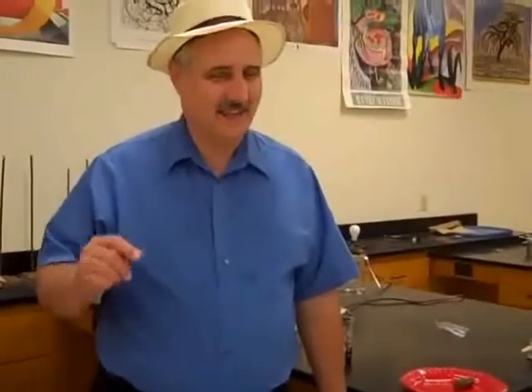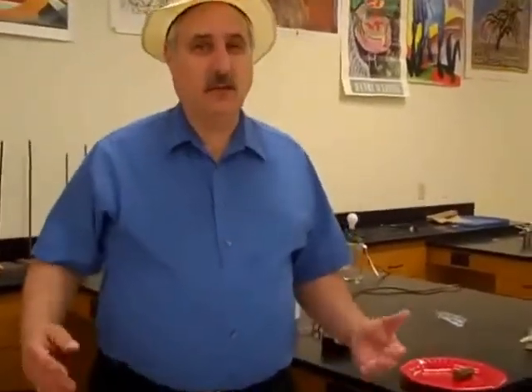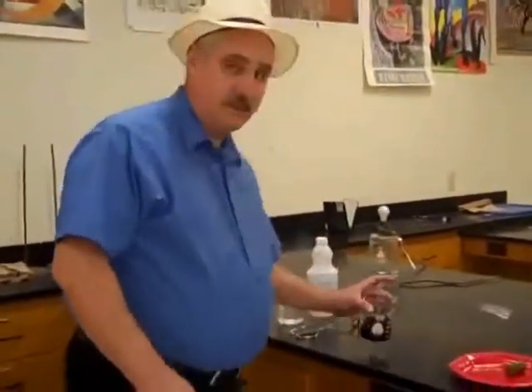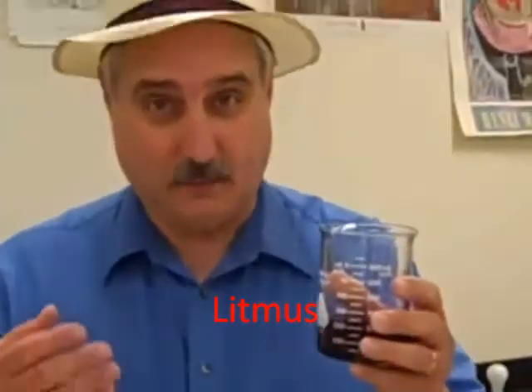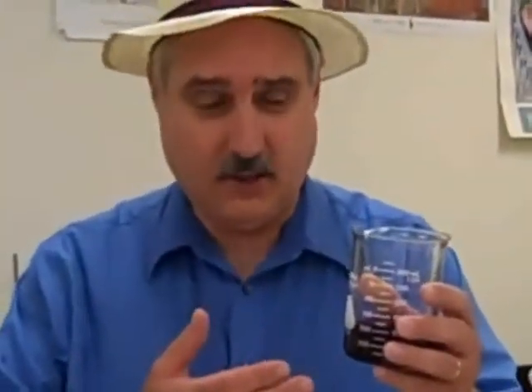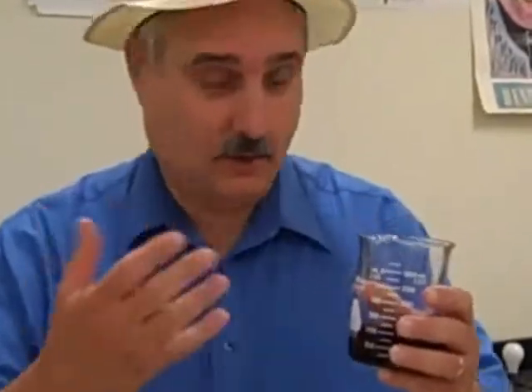Now that's not the best way to test for an acid, to taste it. There are better, more accurate, and safer ways. One way is to use indicators, like this. This is litmus. It's a combination of vegetable dyes derived from lichens, and it changes color in an acid or a base. Now, litmus is usually seen in the form of litmus paper, which is just filter paper with liquid litmus soaked up in it.